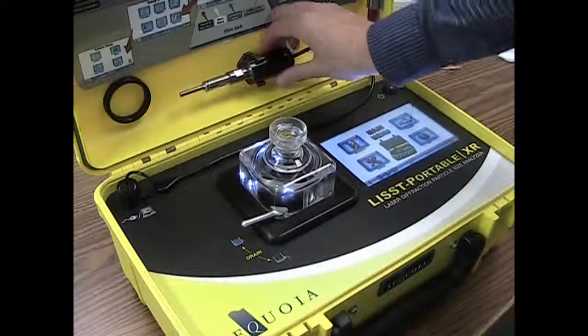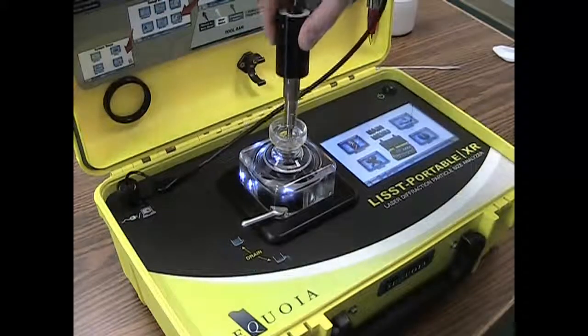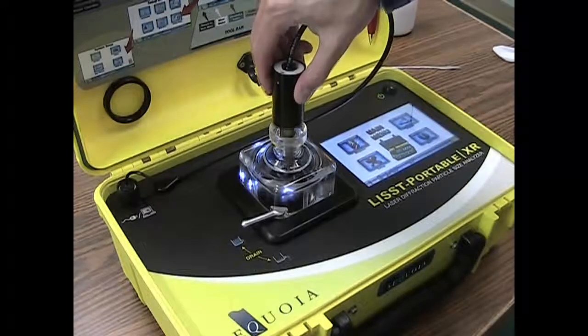Next, insert the ultrasonic probe into the sample chamber. The water level should rise and completely fill the sample chamber once the probe is seated.